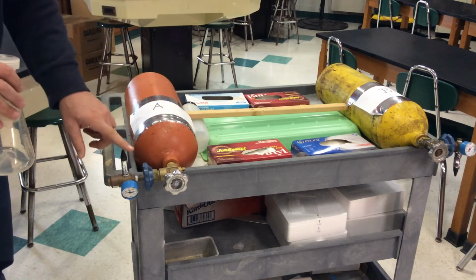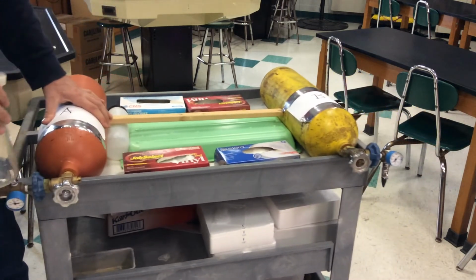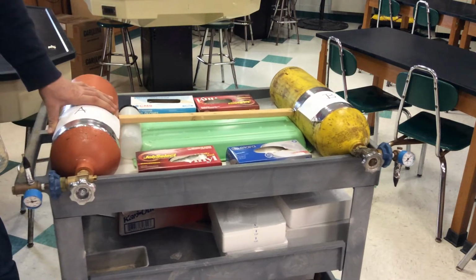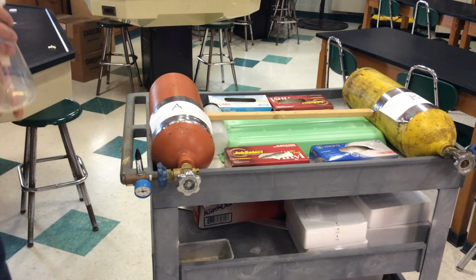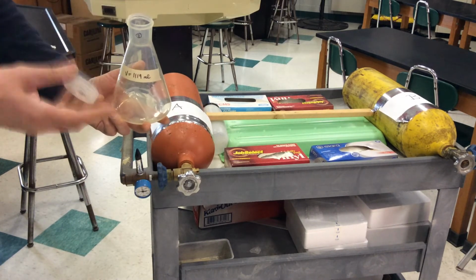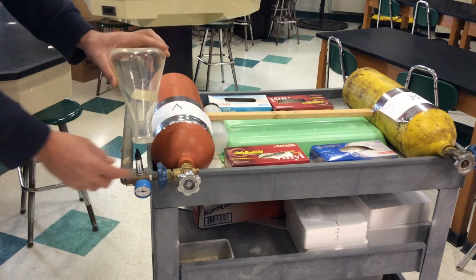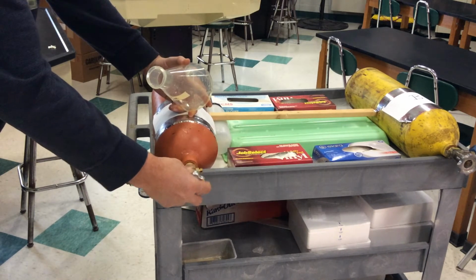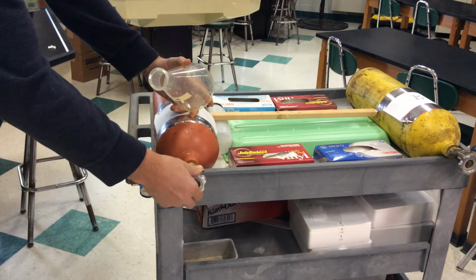density. Now you can see that I have the valve facing up for A, and the valve pointing down for B. There's a reason for that, because of their density. So if I'm going to fill flask A up, the first thing I do is take my cap off. I'm going to keep that handy because I want to cap it immediately after. So I'm going to turn this flask down, and I'm going to open up this container. If it's already open and moves, you're good. Don't crank it open. So leave that open.